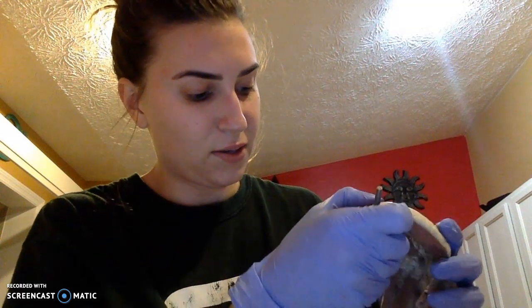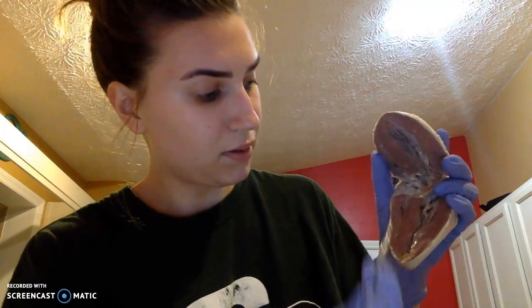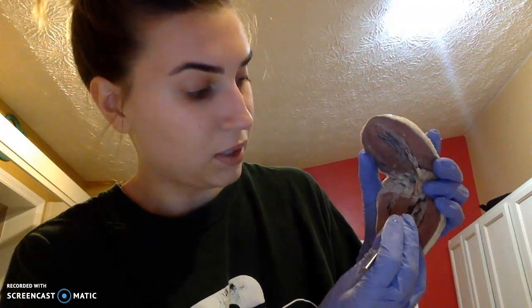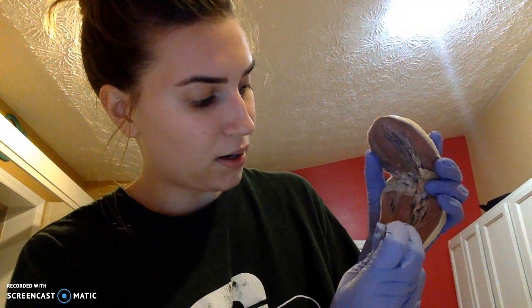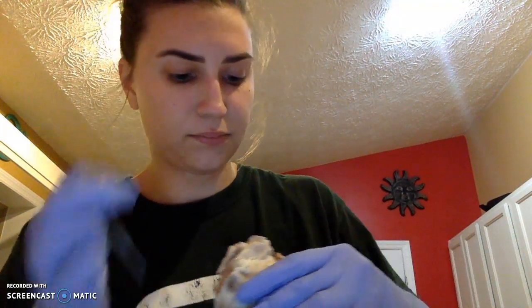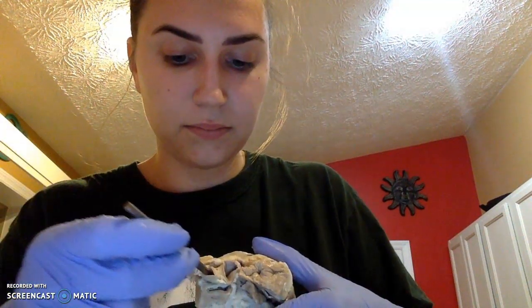So again, we have our right atrium, right ventricle, tricuspid valve, interventricular septum. We're going to have our left atrium, left ventricle, your bicuspid valve, chordae tendineae, endocardium, myocardium, epicardium, pulmonary valve, aortic valve. Thank you.